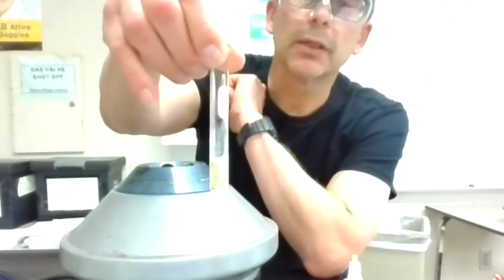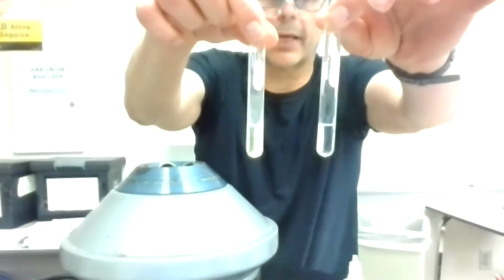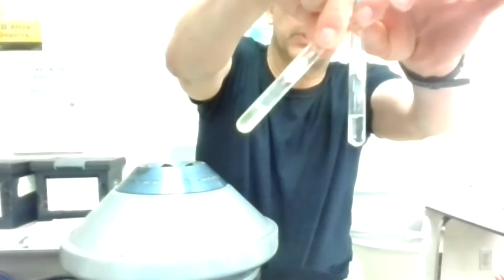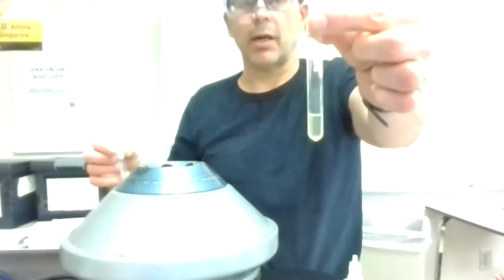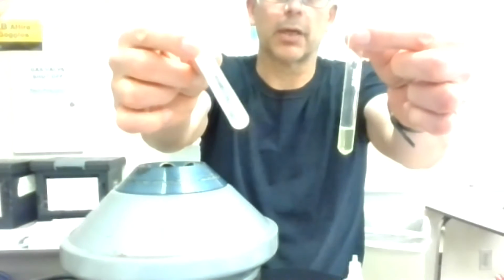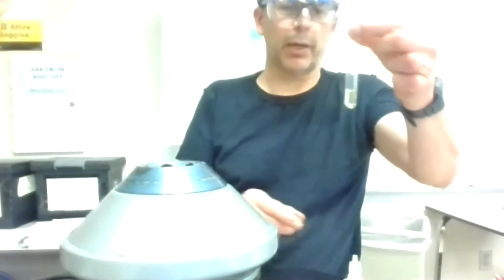So you can see how this is a lot different than the clear one. It's frosting the side of the glass, and then it's stuck on the bottom at an angle on half the side, and there's more precipitate down by that part. So I'm going to dump that into an empty test tube and go to my next step. I'm decanting, leaving that precipitate behind, and I got a nice clear solution. You can see the cloudiness on the bottom and even on the sides of the glass. A little bit messy to clean up.